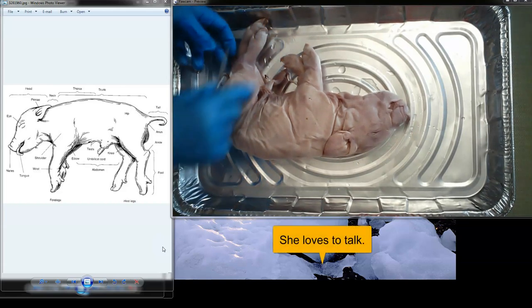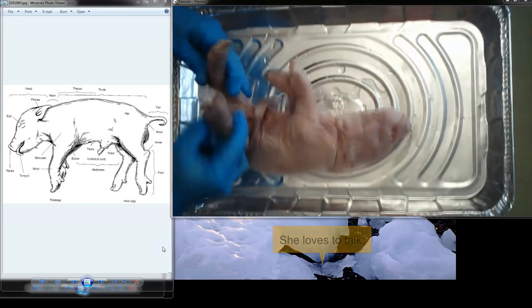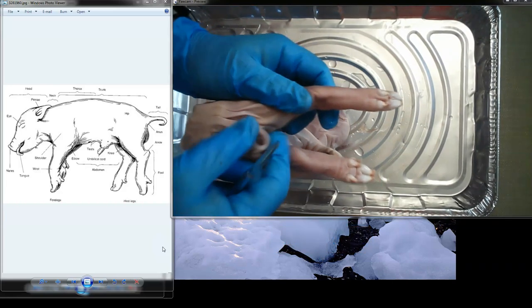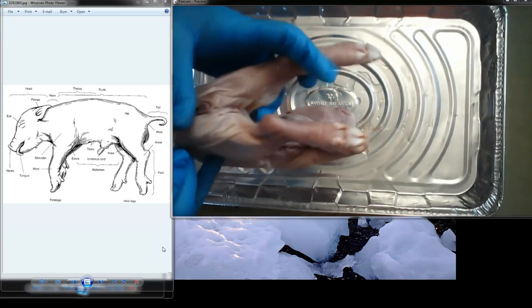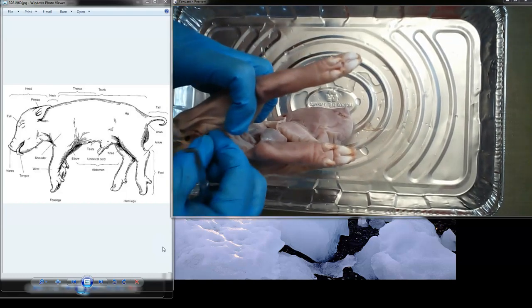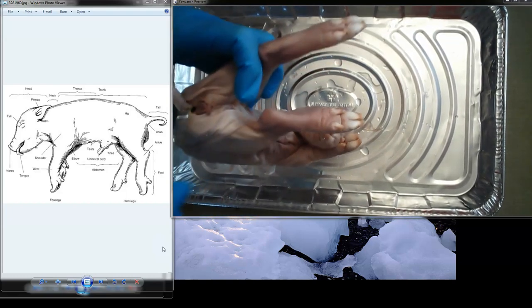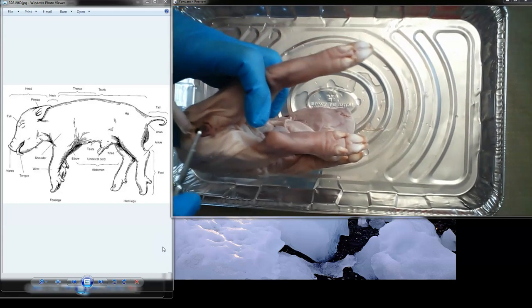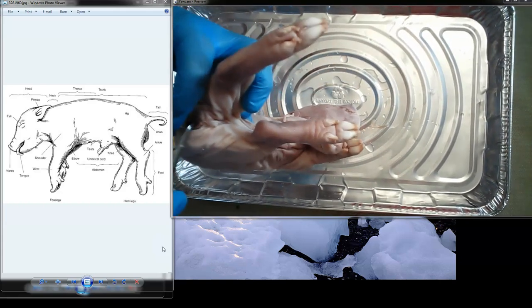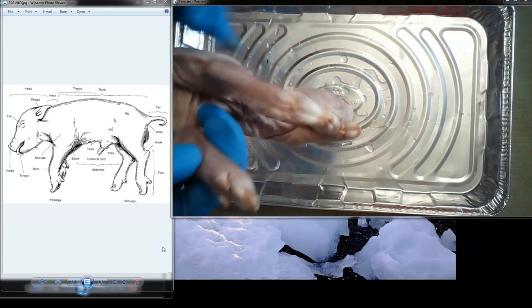Okay, so we're going to take a look at this posterior end of the pig and see what we have. Here's the tail of the pig. We're going to lift the tail, and we can see that we have two openings. There's an opening over here, that's the anus. And then we have another opening over here, and that is called the urogenital opening. So this is a female pig.